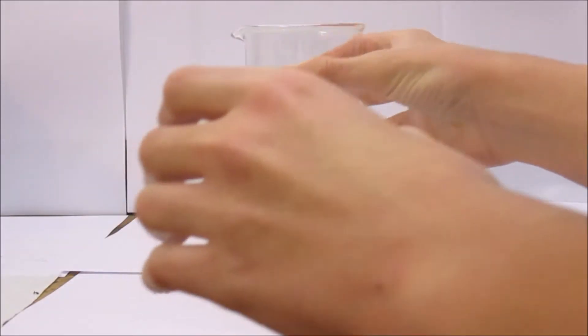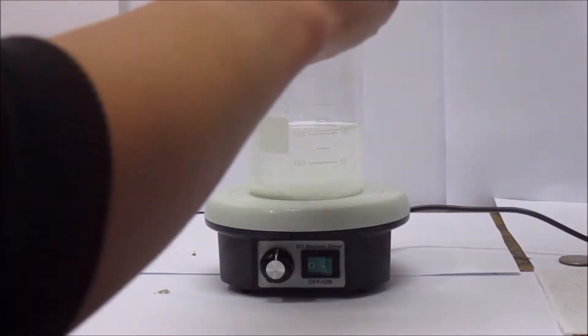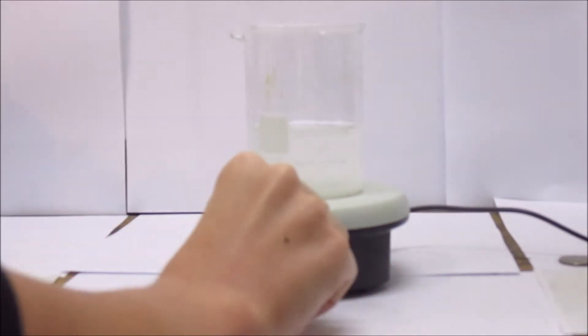And then I placed it on my magnetic stirrer. I added a stir bar, turned it on, and let it dissolve.